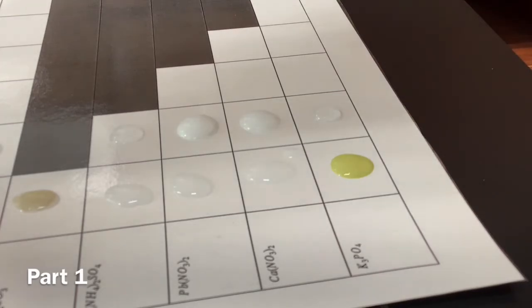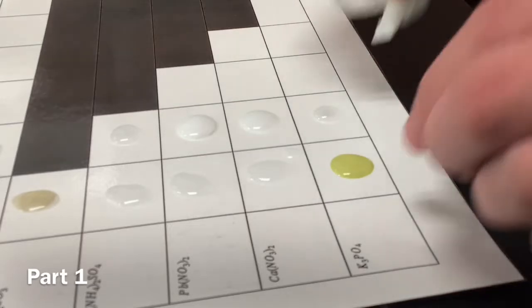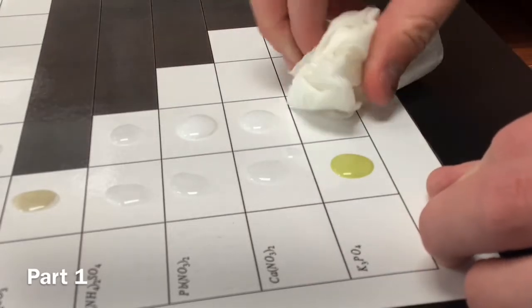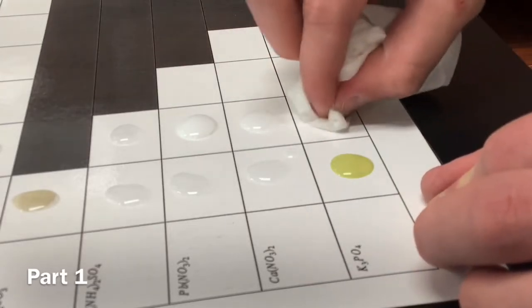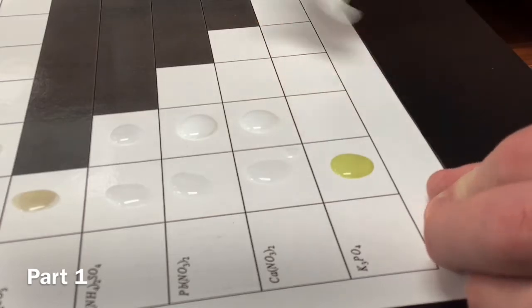I just did it Na2CO3. Wait, did you do it wrong again? Okay, guys, just don't even worry about it. Guys, Taylor is normally very on point, except just for today. He just makes a few mistakes every once in a while.